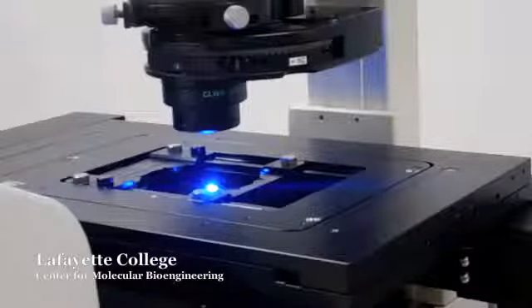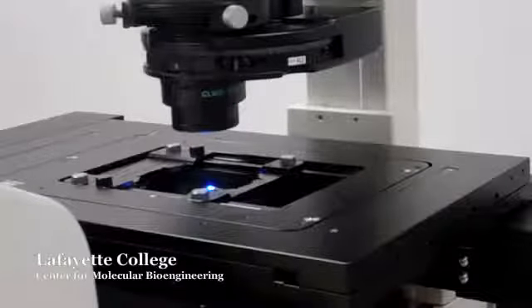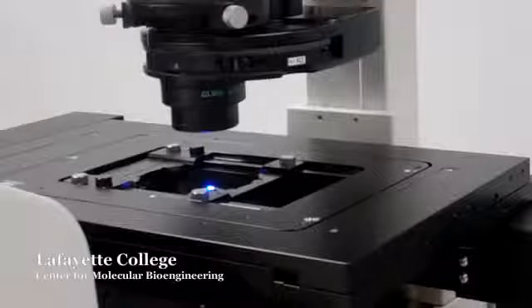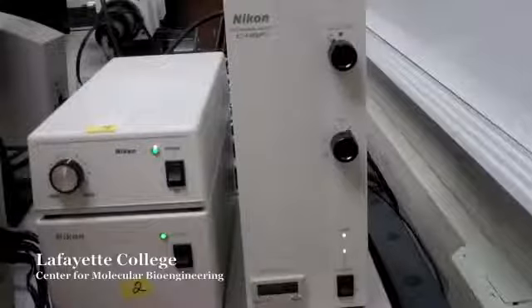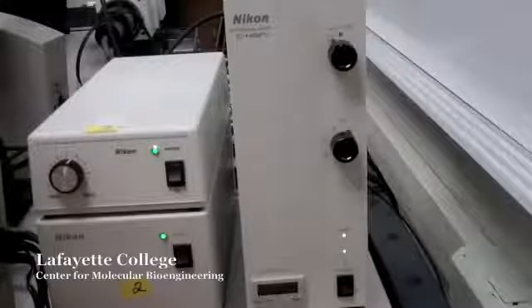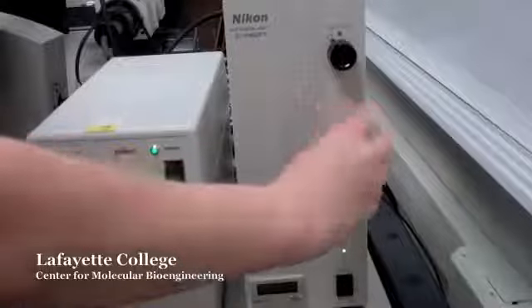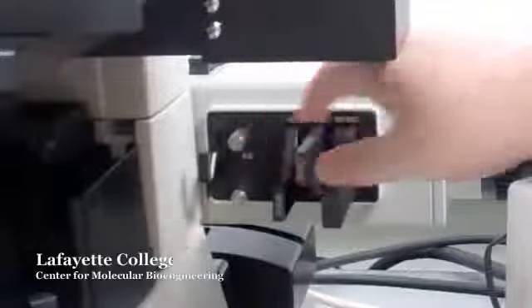It is important to adjust the light intensity to a desirable level. If the fluorescence intensity is too bright, it may quickly quench the samples. There are several ways of adjusting the light intensity. One way is to adjust the neutral density filter found on the Intensilight box. The knob is labeled with numbers between 1 and 32, 1 being the brightest and 32 the dimmest. Additional neutral density filters can also be found to the right of the microscope. Slide these filters inward to decrease the light intensity.